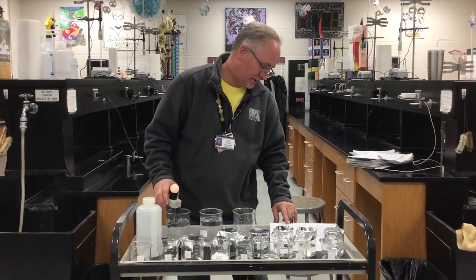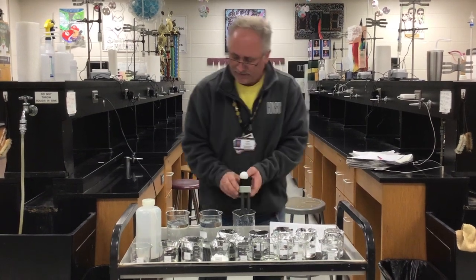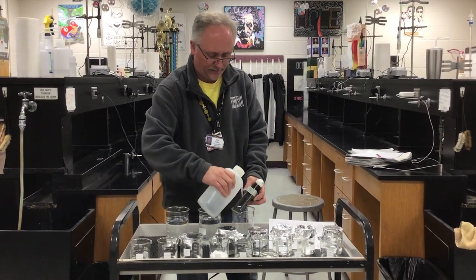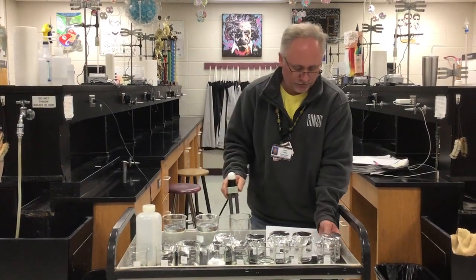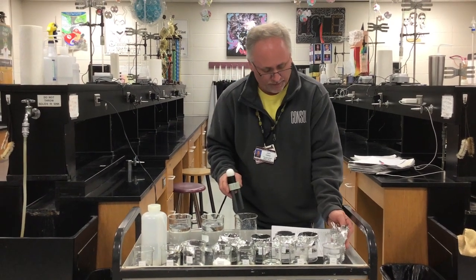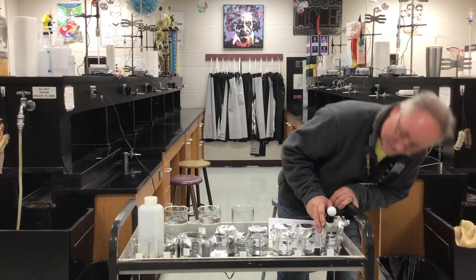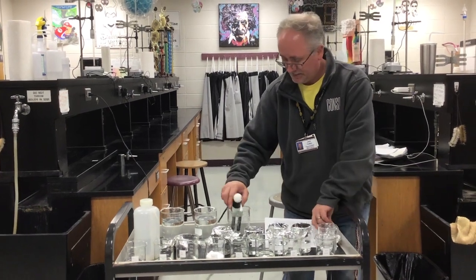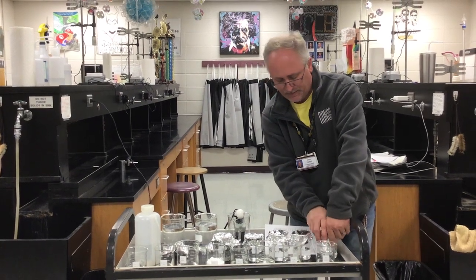After sodium hydroxide is glacial ethanoic acid. What glacial means is that this is pure ethanoic acid. I believe the concentration is 17 molar. It has very, very little water in it, and it's really stinky. It is a weak acid. So what we see is nothing. It doesn't light up at all. Now that's 17 molar or glacial acetic acid or ethanoic acid. They mean the same thing.